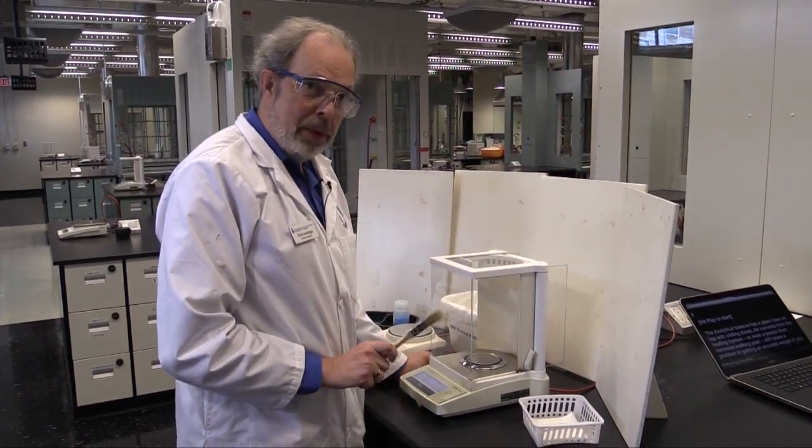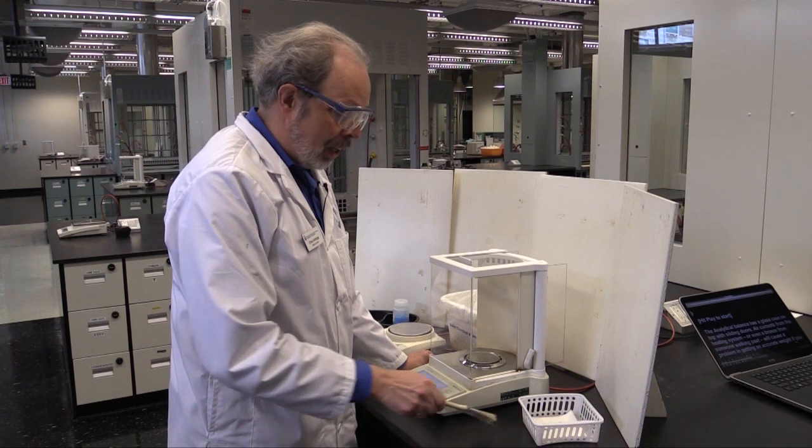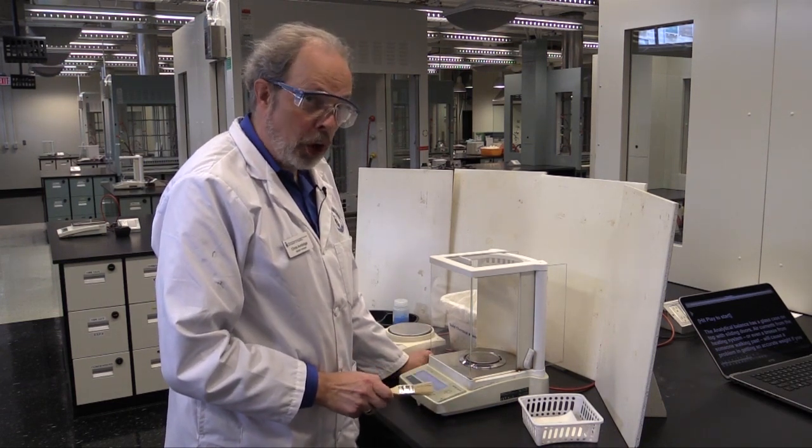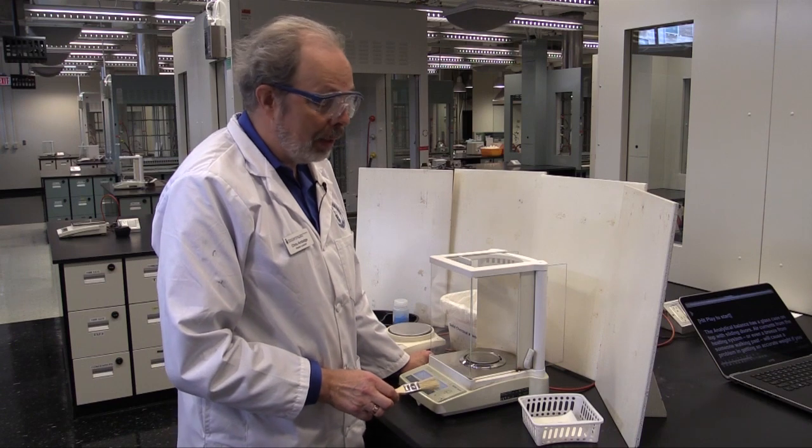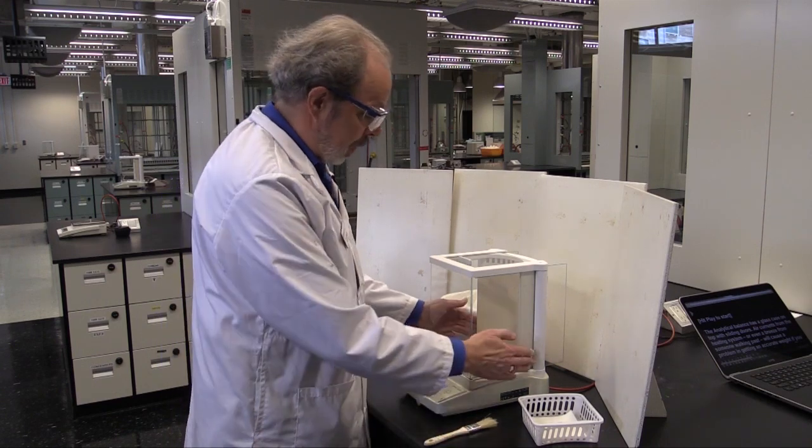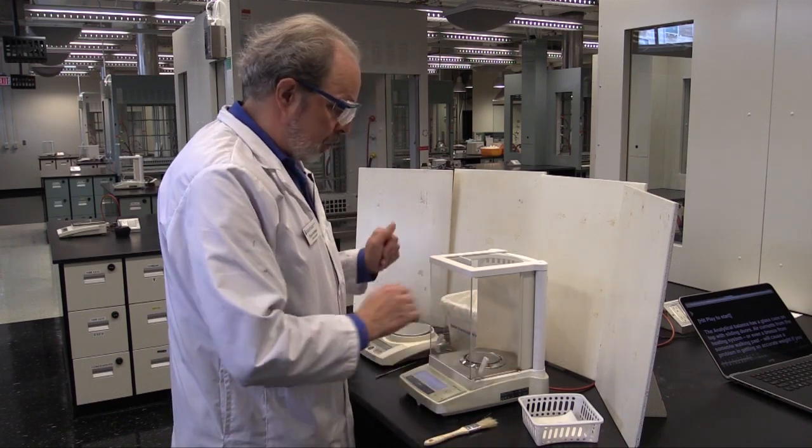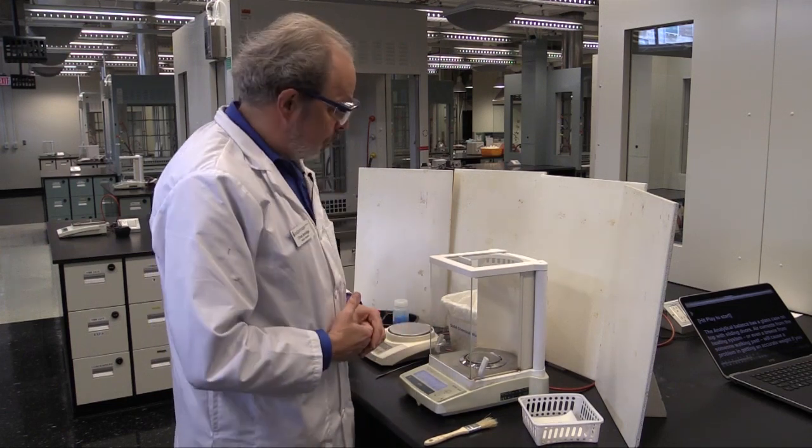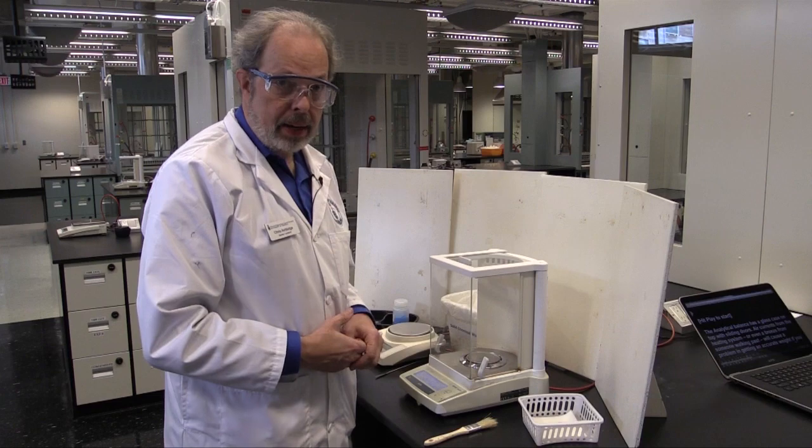Do not, let me repeat this, do not leave solid all over the bench top. Your TA will not be very pleased with you, and neither will I, if you leave the balance area dirty. But once you have done that, you have now mastered the art of weighing, using both a top loader and an analytical balance.